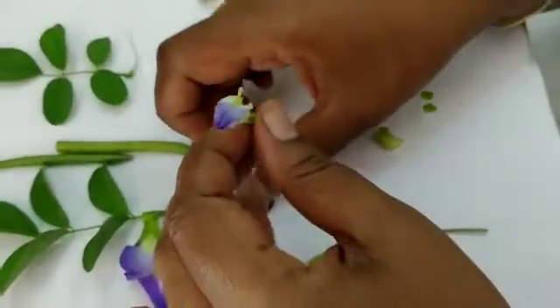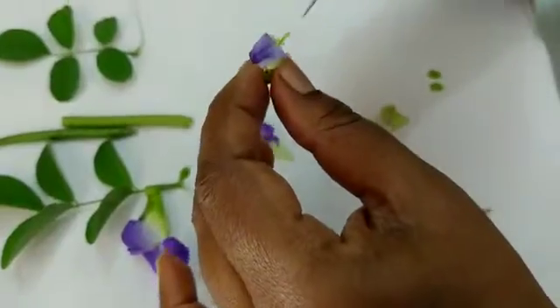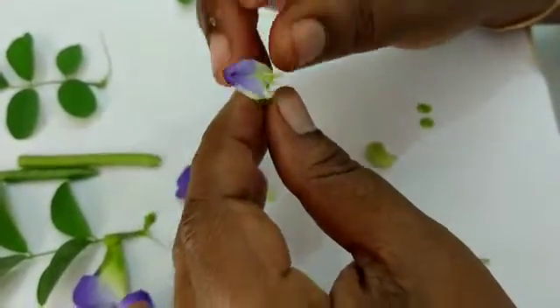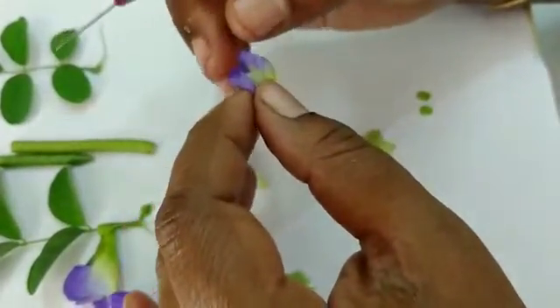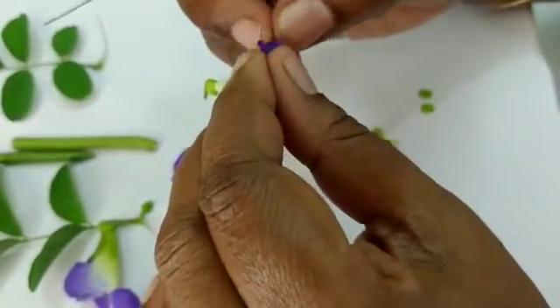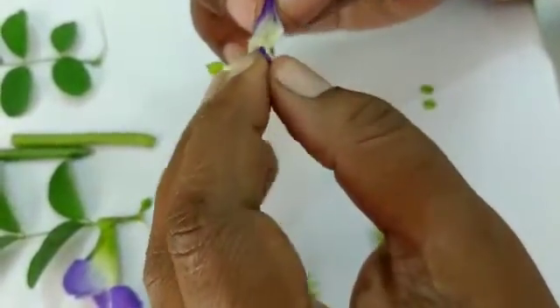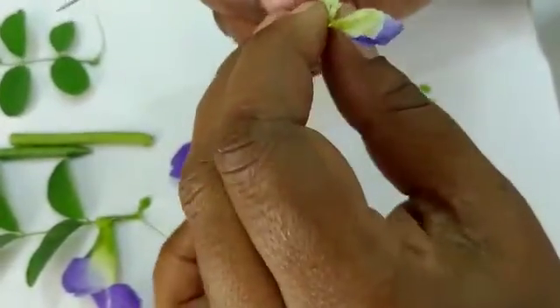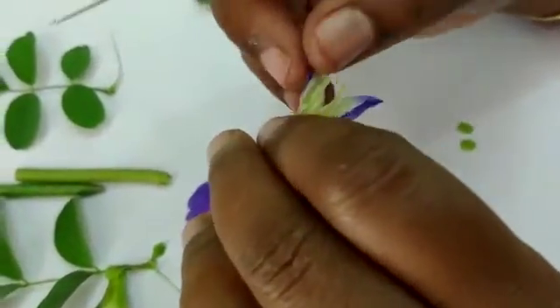Next, let me remove the wing petal — it is like a wing, so it is called the wing petal. Two wing petals are present. Inside that, you can see the keel petal.